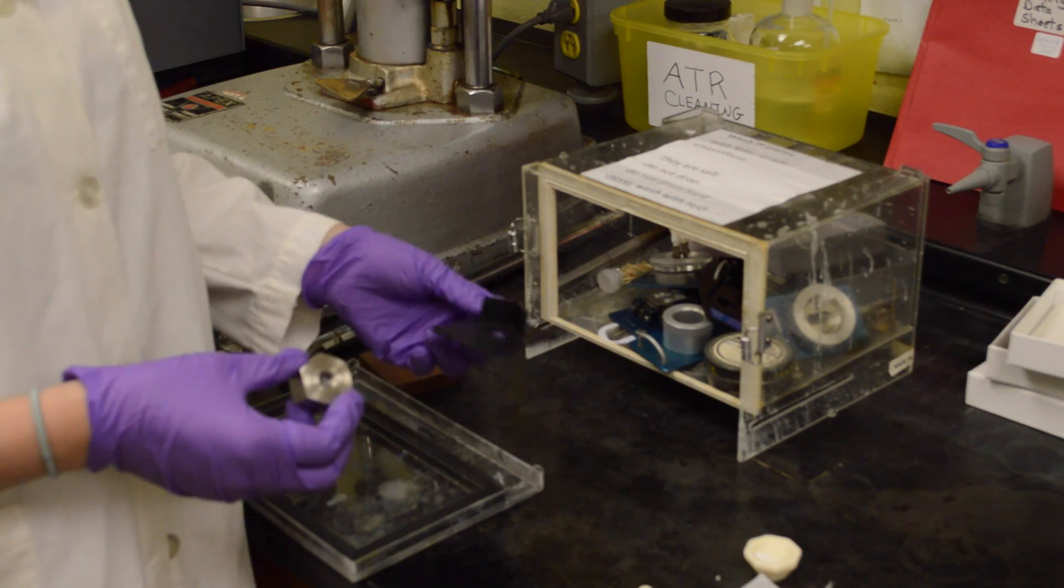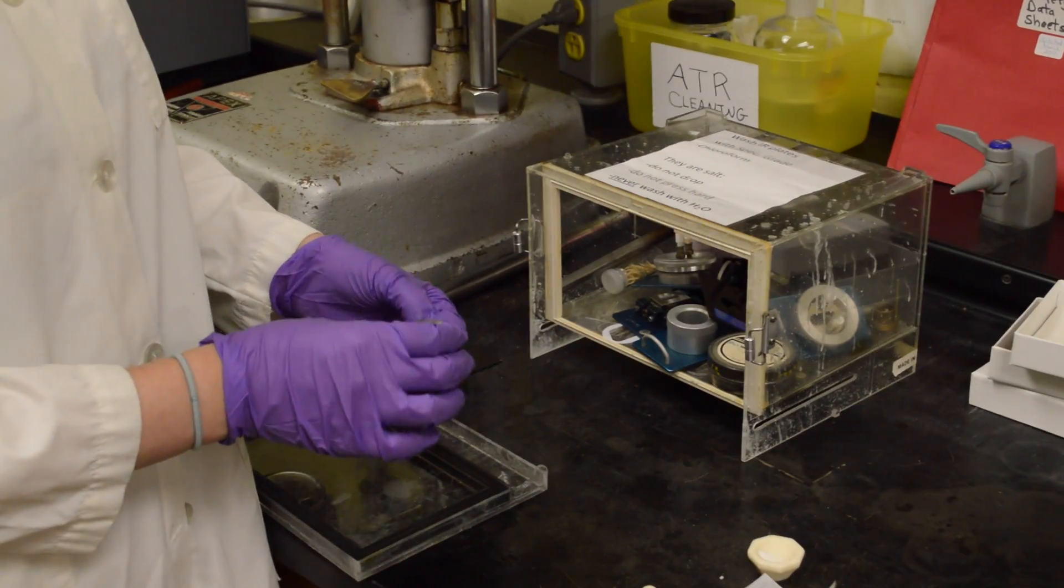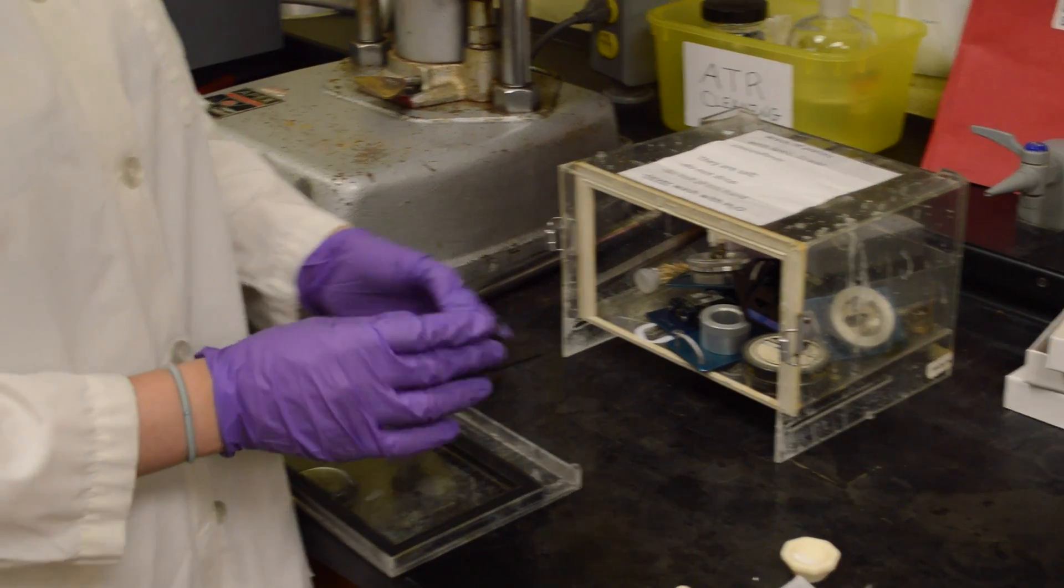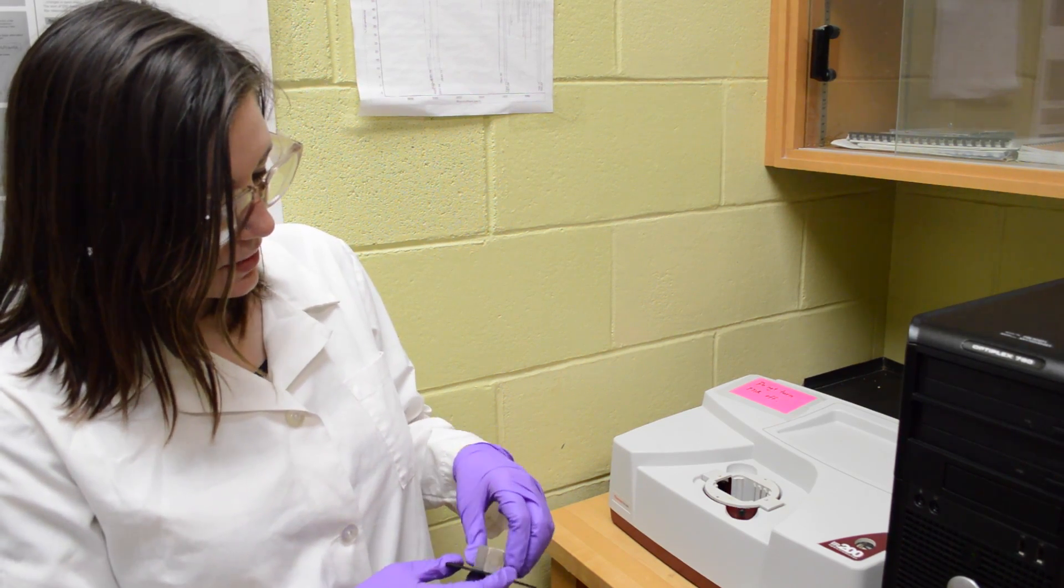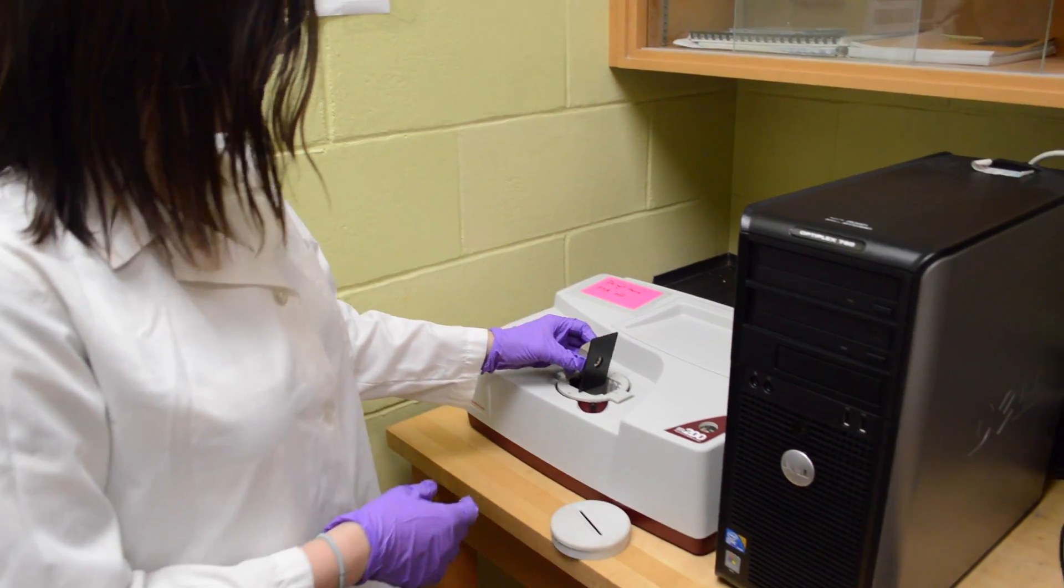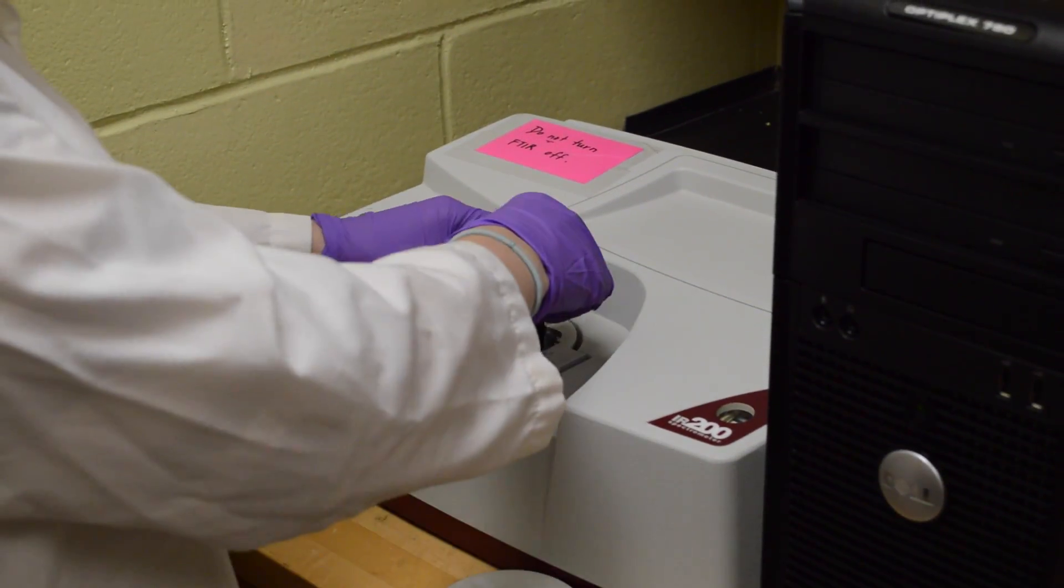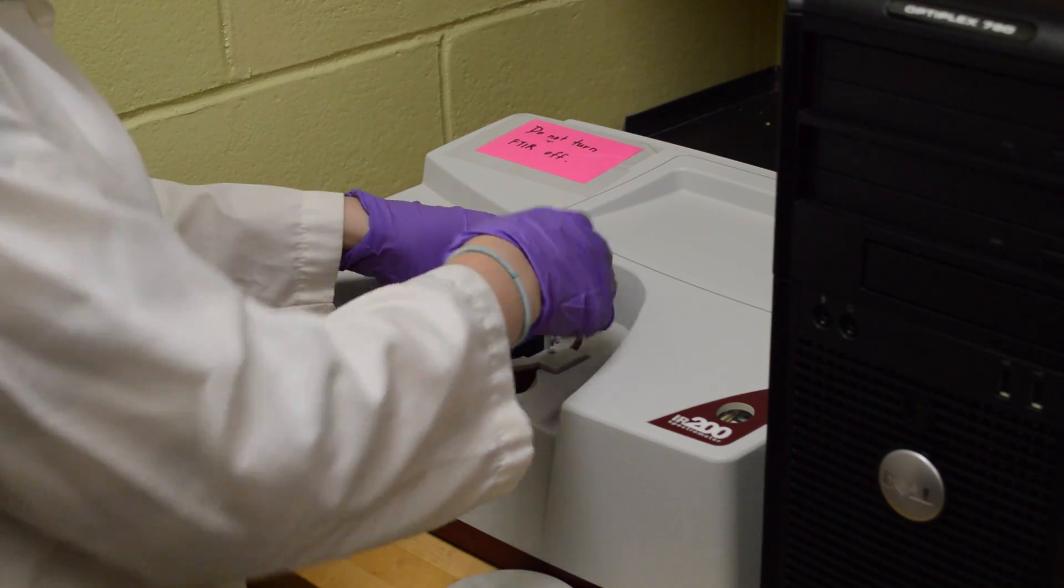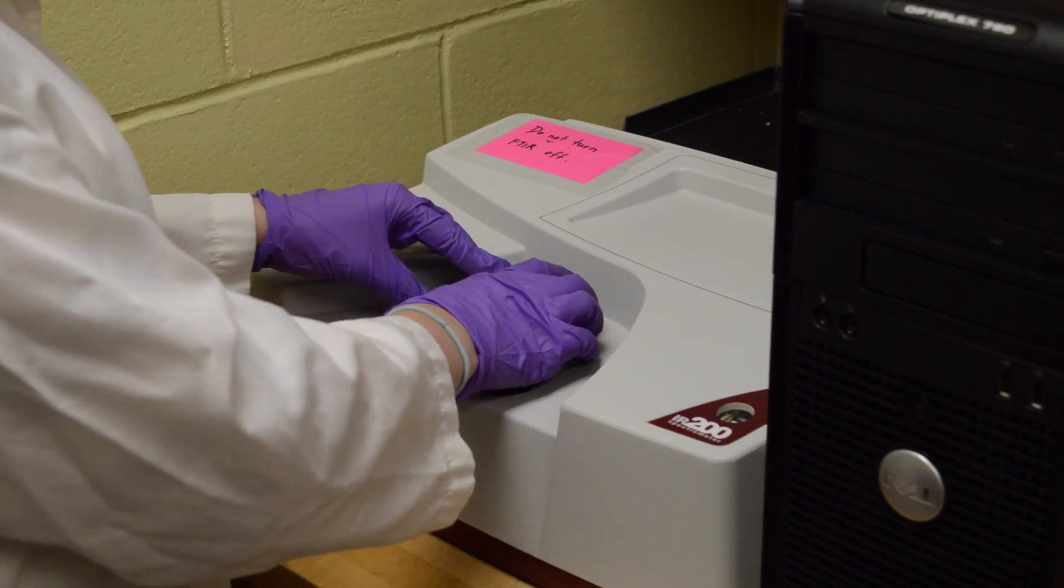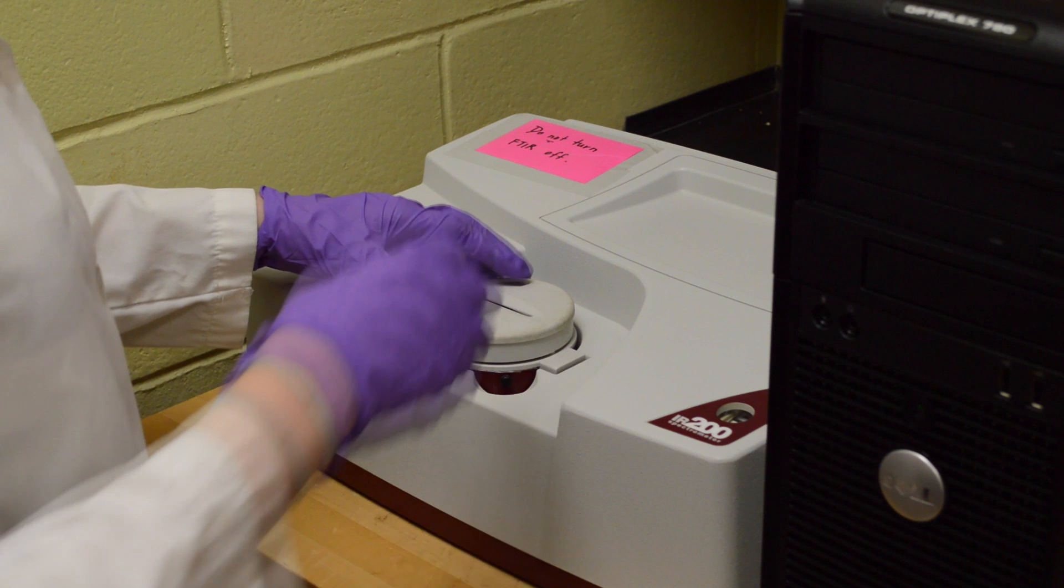You just have to put the barrel inside this black holder and then we'll take it over to the spectrometer. You want to insert that plate holder with the barrel right inside the second slit, just like you would for an IR with the salt plates. Then cover it back over, and you're ready to go.